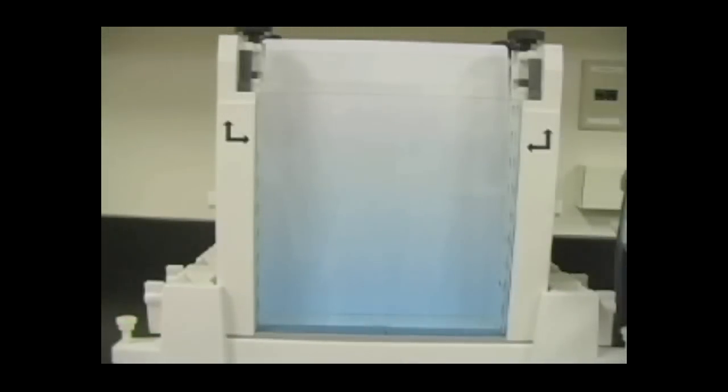You can see that the finished gel is lighter in color on the top and gradually gets darker toward the bottom, showing that a gradient has been formed. Once again, we artificially colored the heavy solution blue so your gel will be clear.